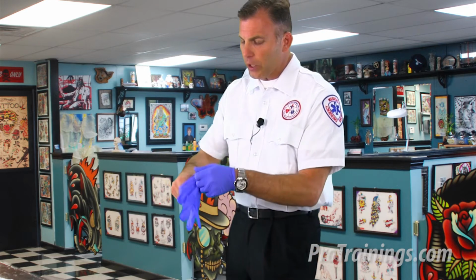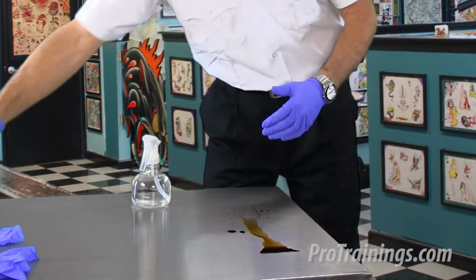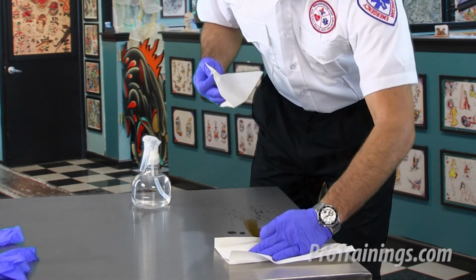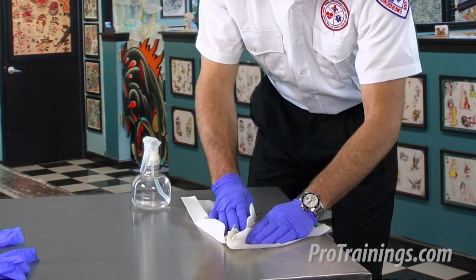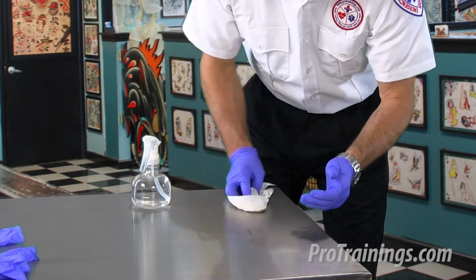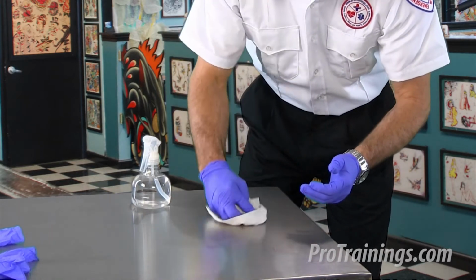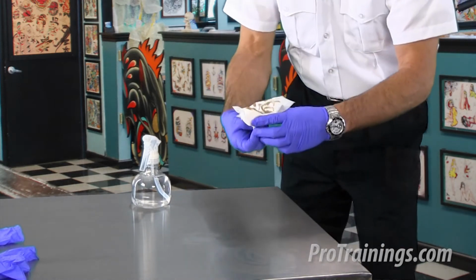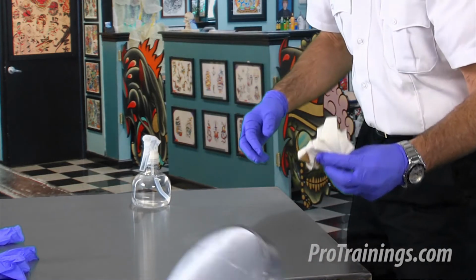After my first pair of gloves are on, I'm going to take my towels and wipe down, being careful not to cross-contaminate. I want to keep all the fluids on the surface and just wipe up the majority of the copious amounts of the spill. We're not trying to get it perfect.